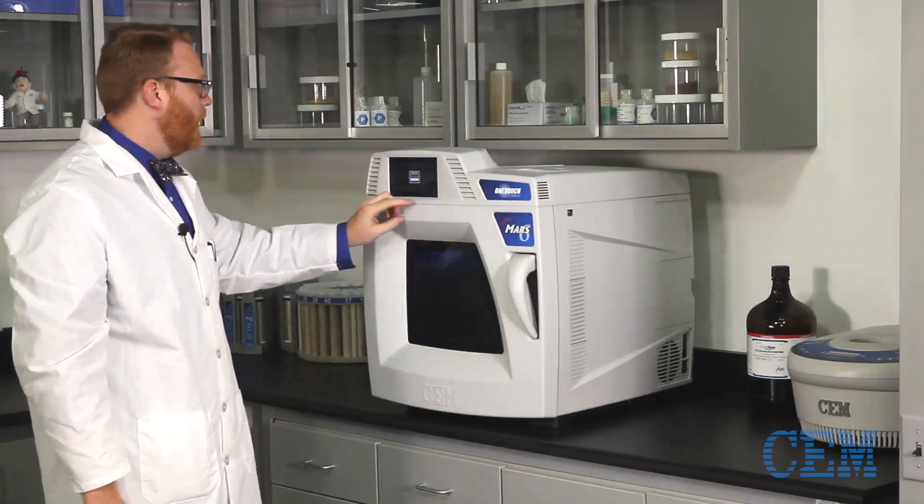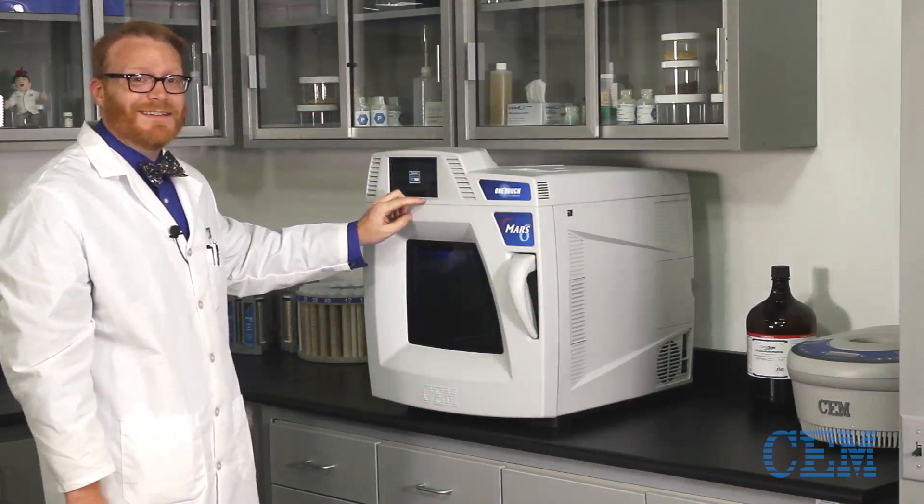Now that everything's in place, let's get the method and digest this, or as I like to say, zap it.